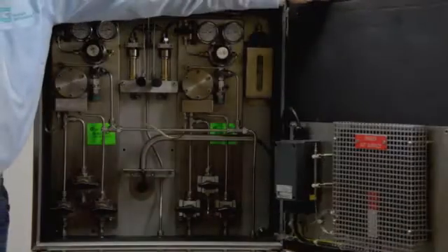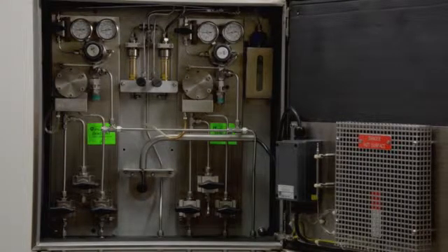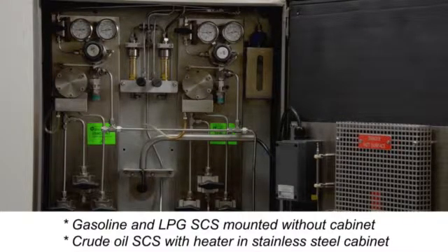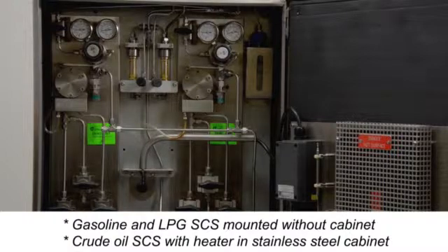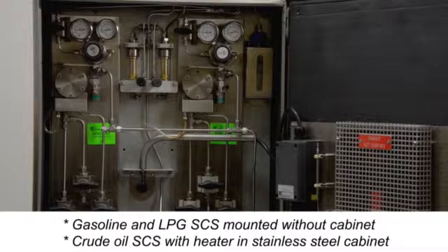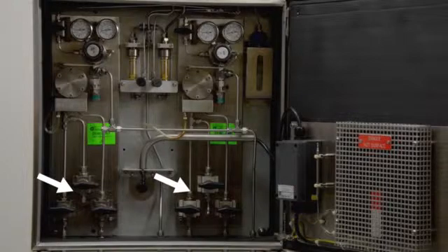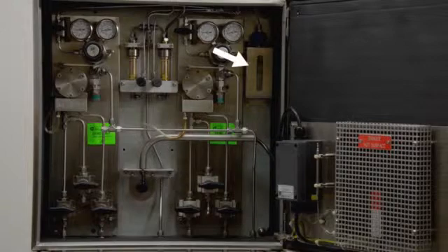The sample conditioning system — the SCS — is located at the bottom of the measuring cabinet and can handle pressures up to 7,000 kPa. A gasoline and LPG SCS is usually mounted without a cabinet. A crude oil SCS is contained within a stainless steel cabinet. Two streams for gasoline, LPG, or crude oil can be connected. The third valve is for the calibration liquid.